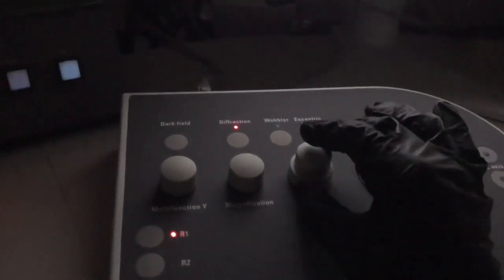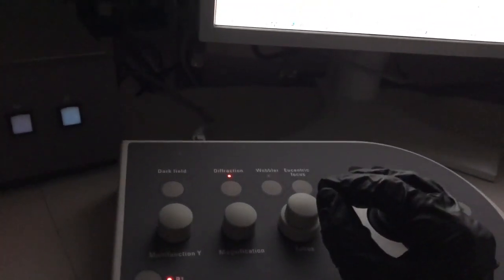So what I have to do now, and this is hard to do with the camera, is look through these binoculars using my focusing screen. If I was to look through the binoculars here, what I'm going to see is that aperture rim superimposed on the diffraction pattern. Then I can look at the edge of that aperture and assess if it's in focus. In focus means that it's sharp. This is hard to show just with the camera in my hand, but it's easy to see looking through the binoculars if that aperture edge is blurry or if it's sharp.